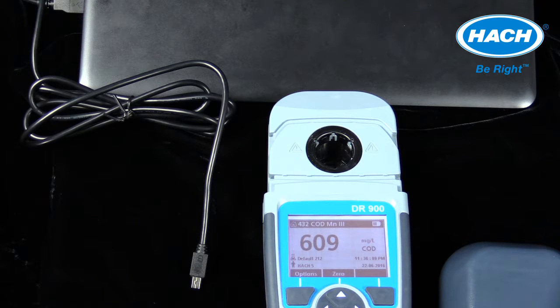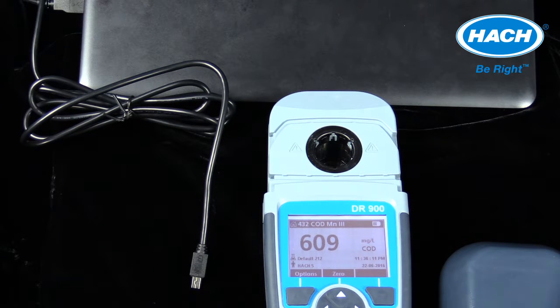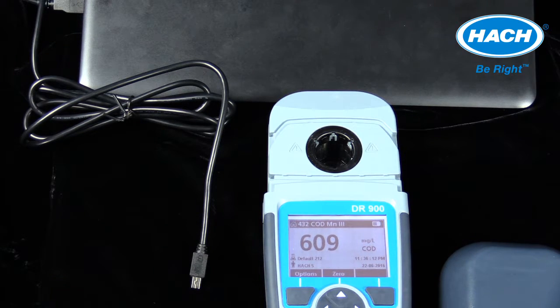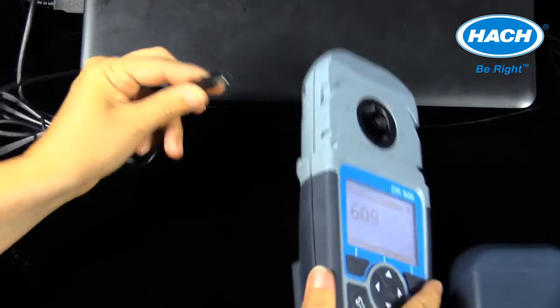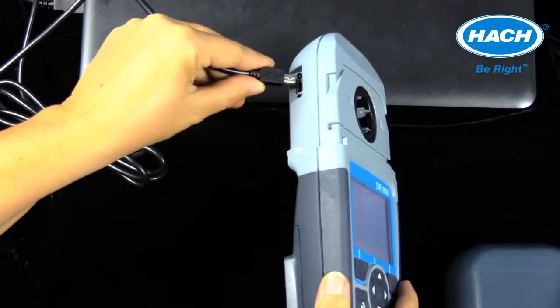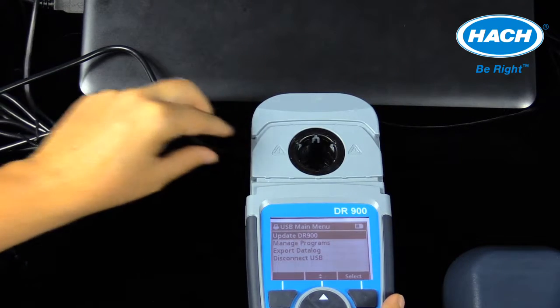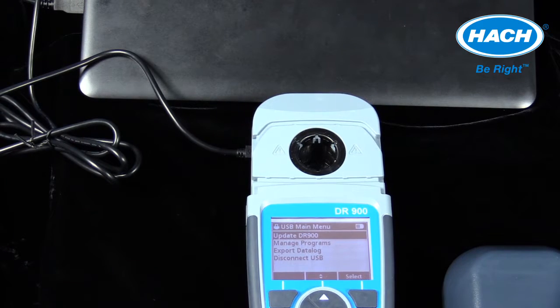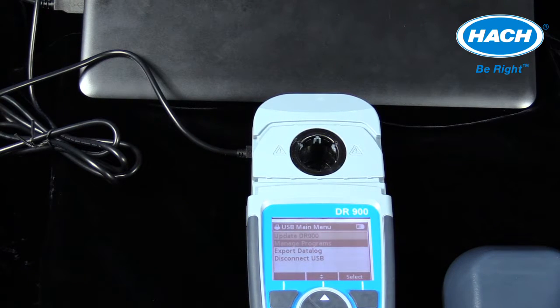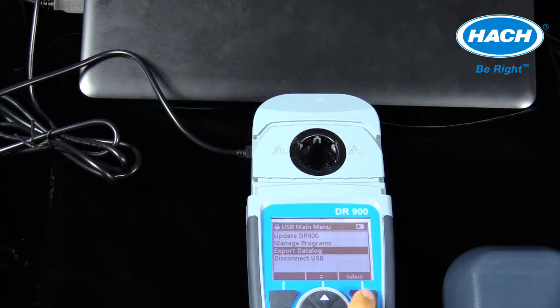Remove the sample lid and connect the USB cable from a PC to the USB port on the DR900. The DR900 will advance to the USB main menu. Select export data log from this menu.